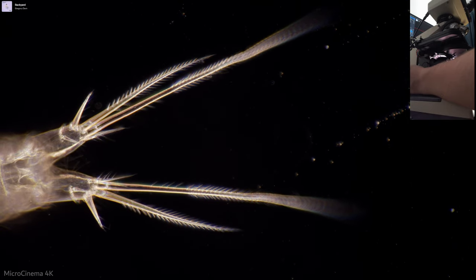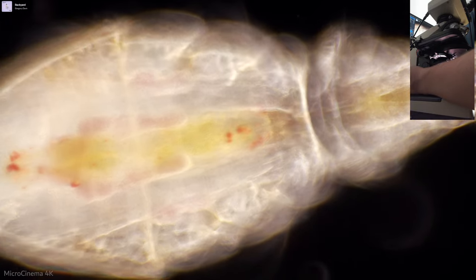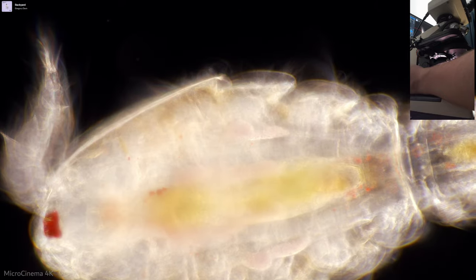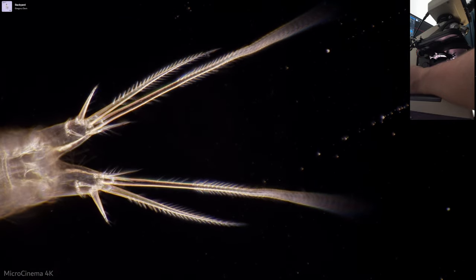So that's always famously pretty difficult to get dark field at. It's not impossible, especially if you use oil, but of course that has its own drawbacks. And so here we are getting nice dark field. Oh, just so good.